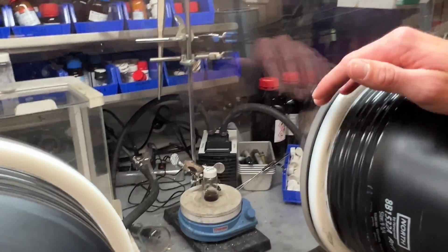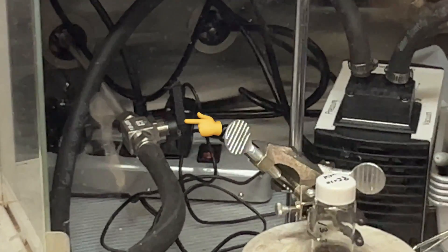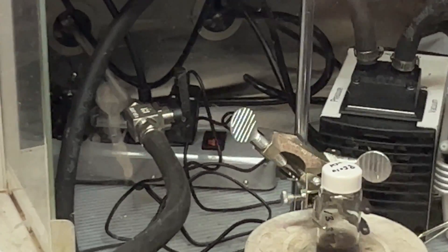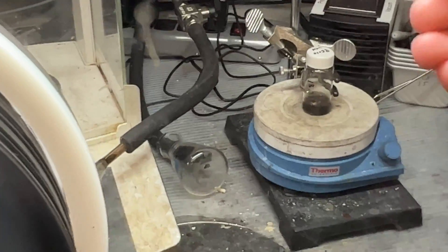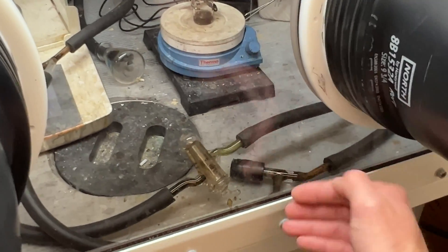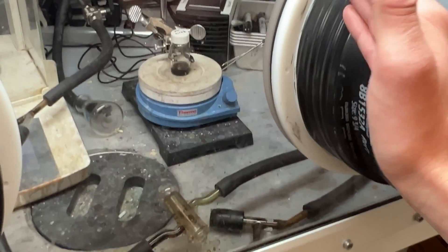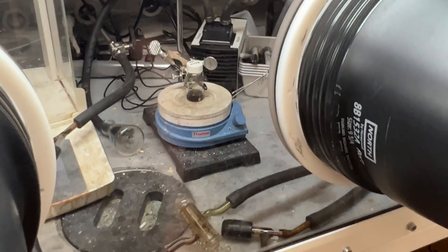Now let's go ahead and look into the glove box. Towards the back end, we're going to notice a black perpendicular valve. That's our main switch valve that allows vacuum to get pulled up to that point. From there, after we pull it parallel pointing towards us, we're going to notice these vacuum lines that lead into our secondary valves where we're able to then pull vacuum on a reaction occurring there or to pull a solid product.